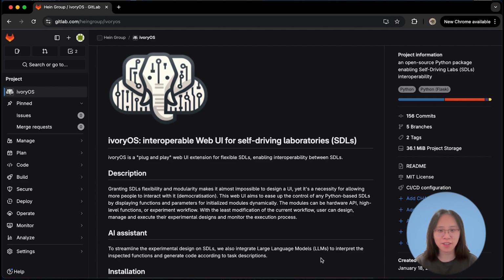In this video, I will introduce you to IvoryOS, which is interoperable software that can help design and control robotic workflows over self-driving labs. I will briefly explain how we achieve this plug-and-play web UI design, and then I will give a quick demonstration of how to use some key features of IvoryOS using an abstract SDL Python script. At the end, I will also demo some real robotic workflows using our self-driving solubility platform.